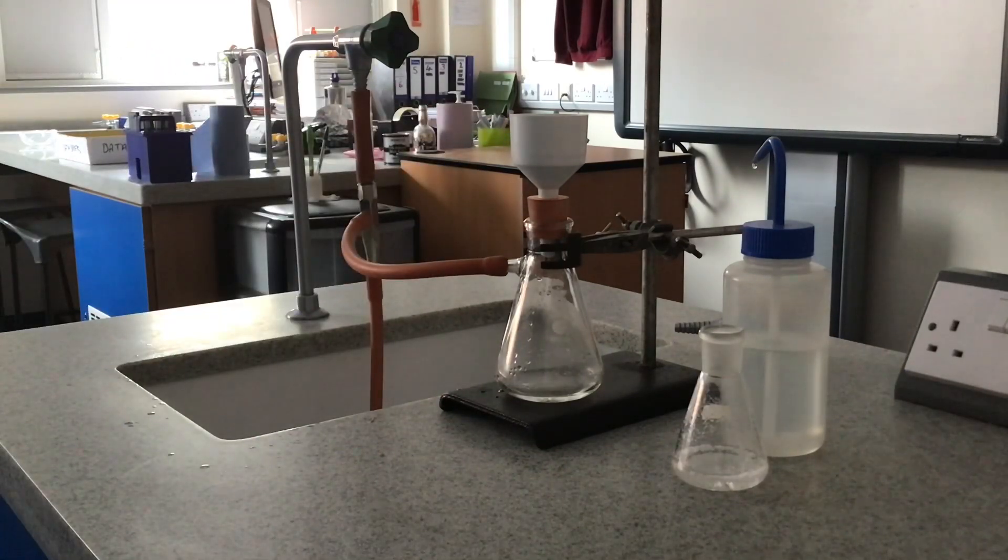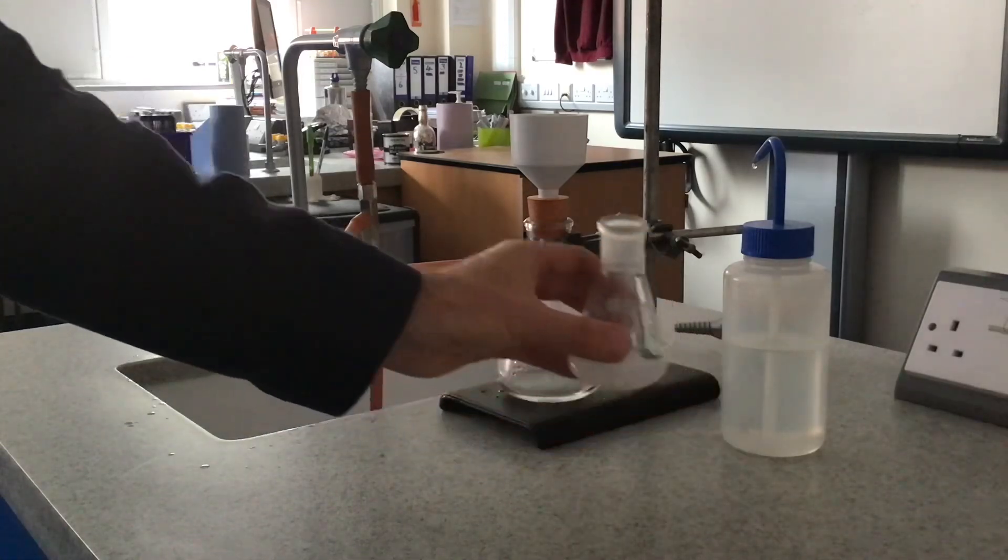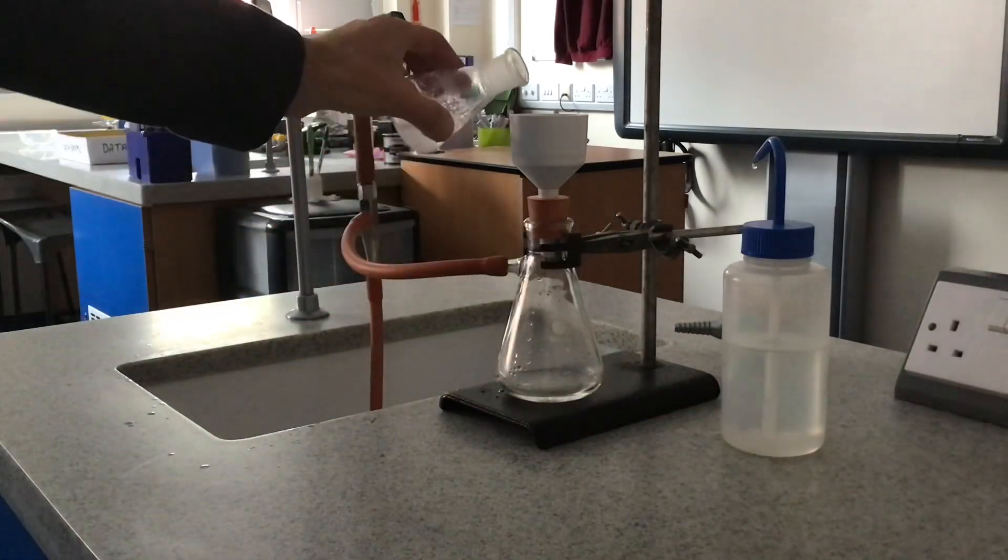All we need to do now is pour the mixture through the Buchner funnel.